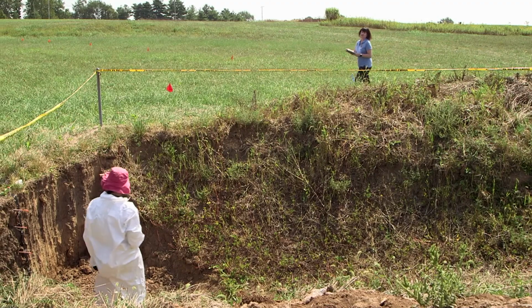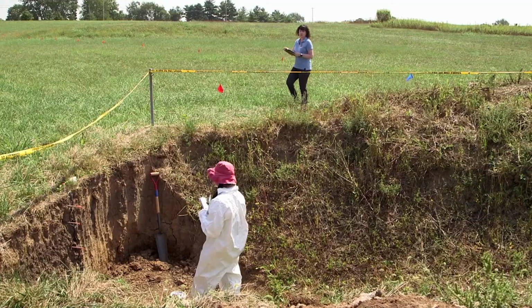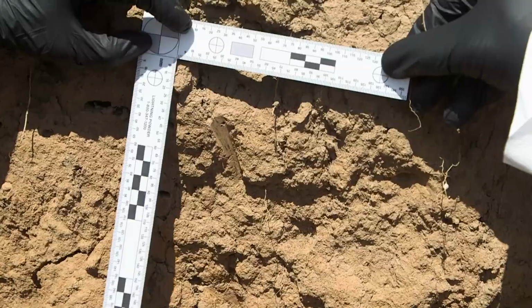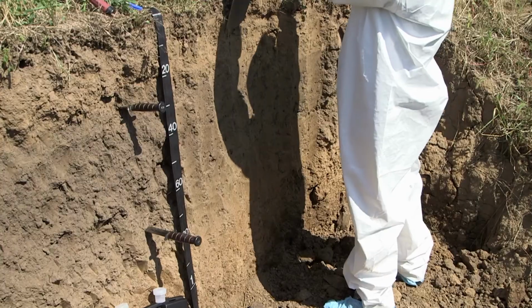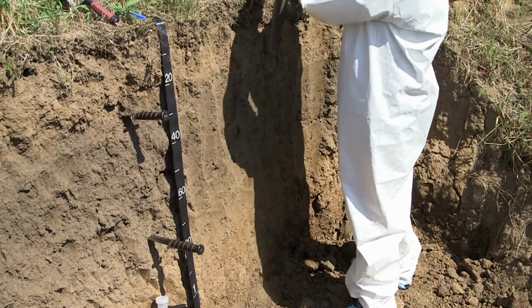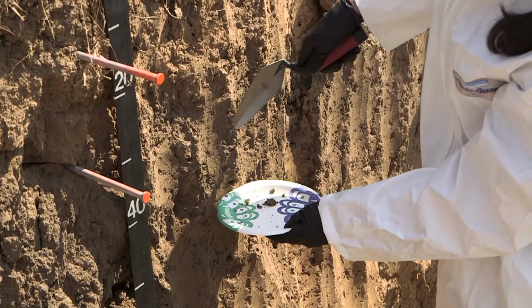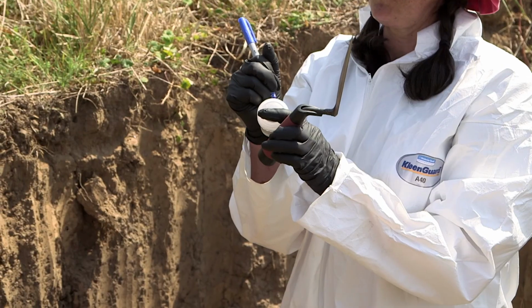When collecting soils at a soil disturbance such as a burial site, it is important to collect them to represent the variation down to the deepest point of the soil disturbance. Examine the grave for marks from digging tools or shoes. Clean the profile top to bottom, away from areas of decomposition products. Collect each layer as a separate sample and record the location, depth, and description of each.